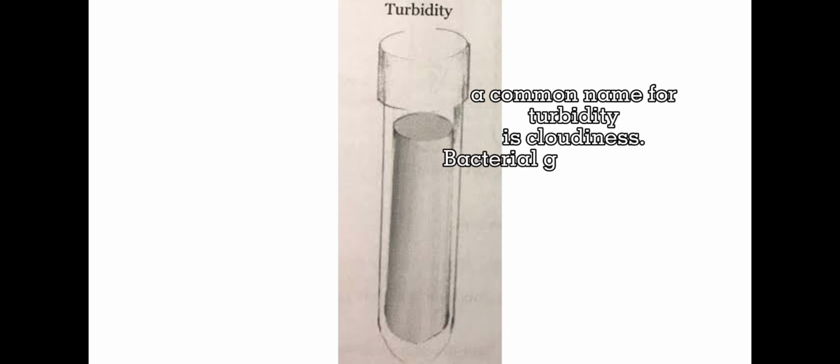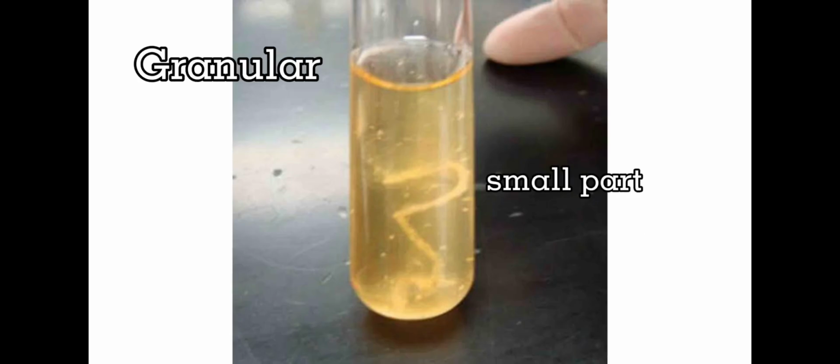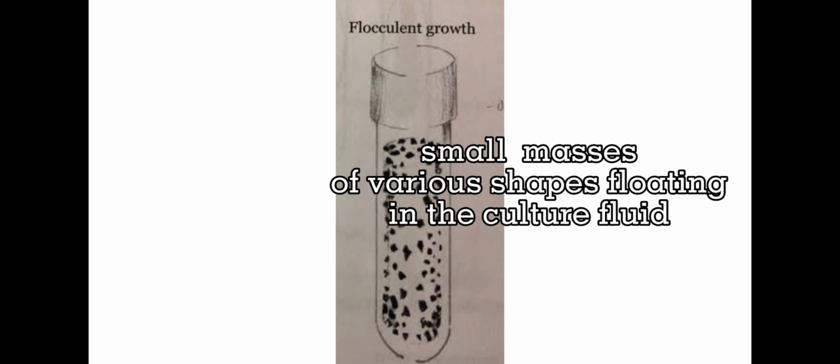Turbidity. A common name for turbidity is cloudiness. Bacterial growth in broth makes the broth turbid or cloudy at all levels in the tube from top to bottom. Granular: small particles. Flocculent: small masses of growth of various shapes floating in the culture fluid.